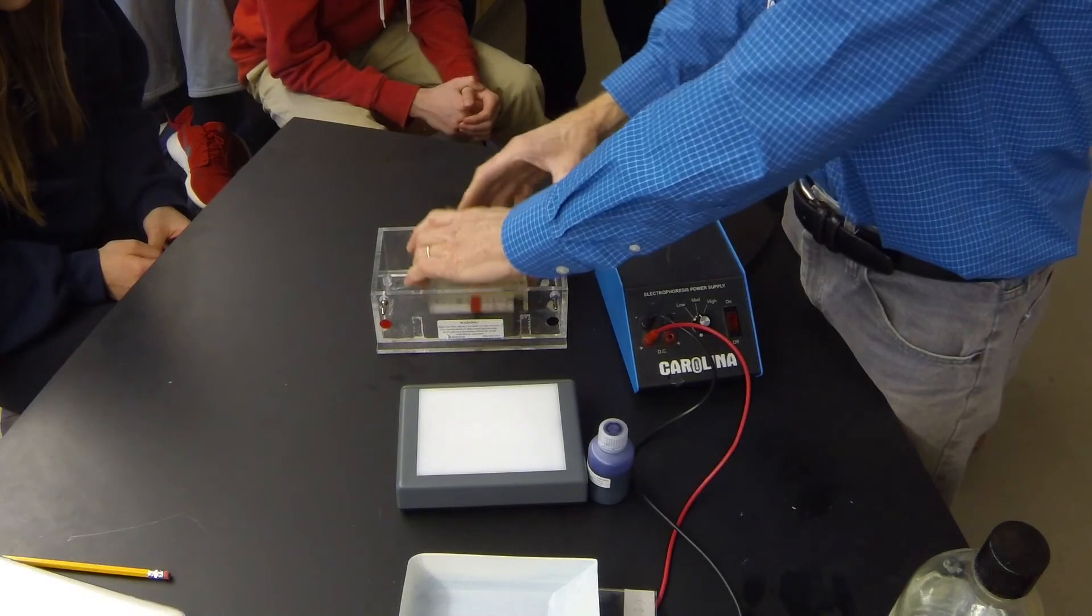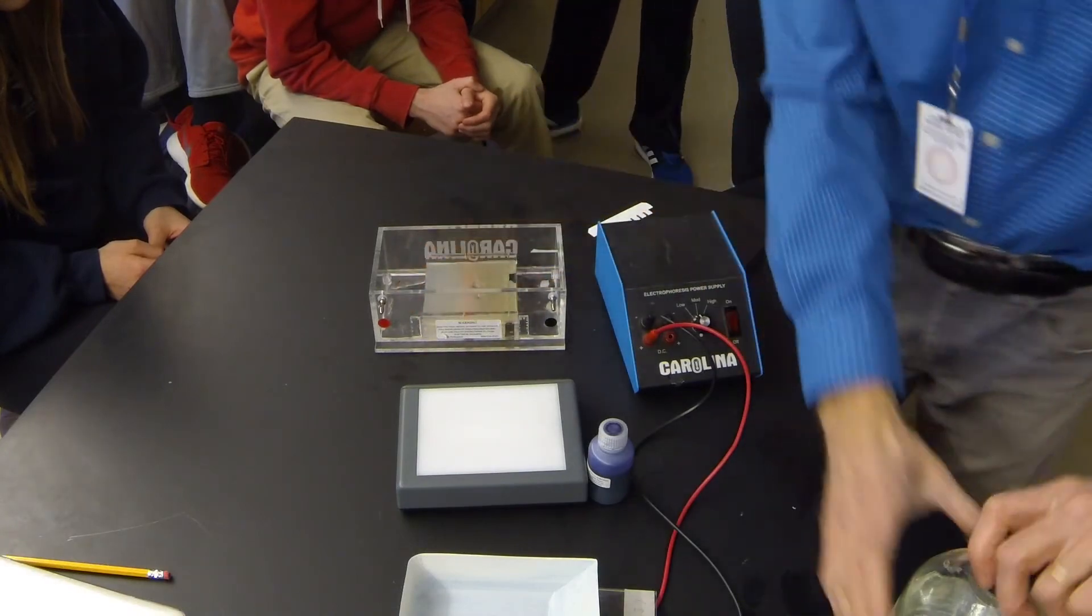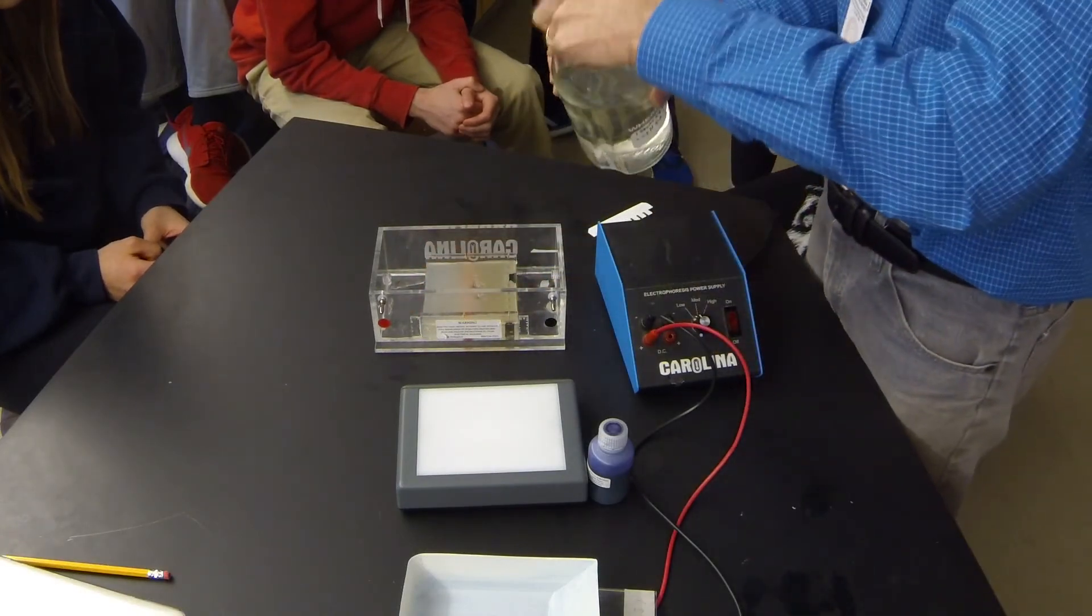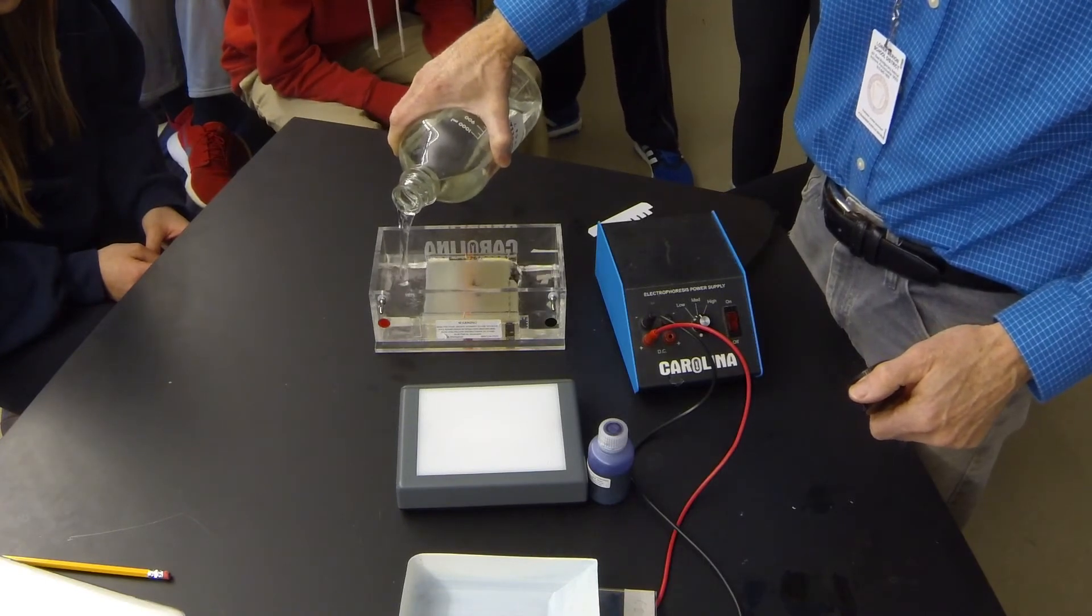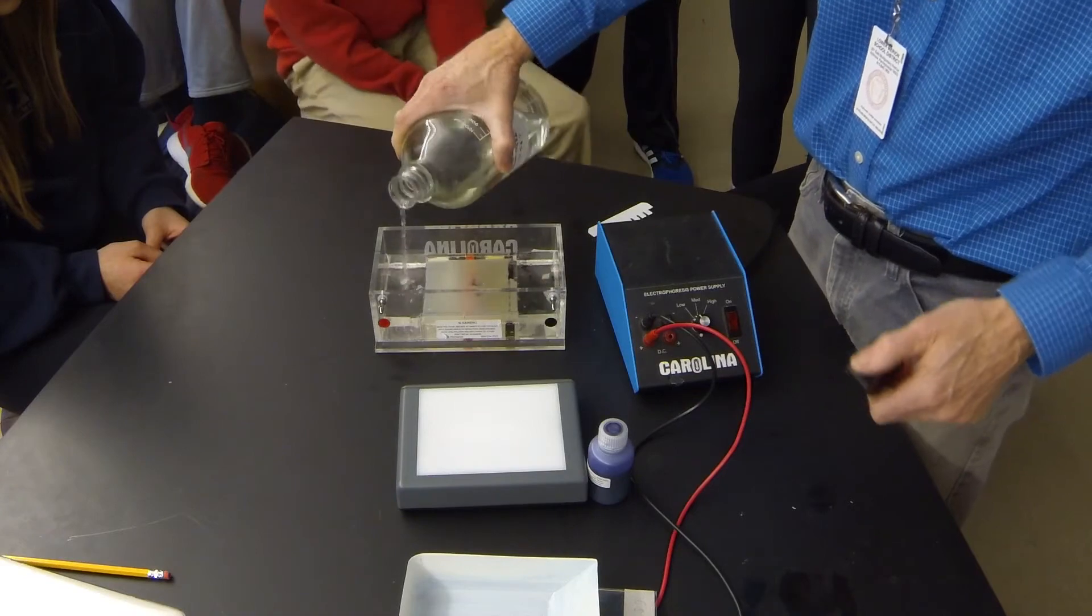I put this gel in the chamber. I add a buffer solution that acts as an electrolyte. It conducts electricity because this chamber is going to be electrified with a power source.